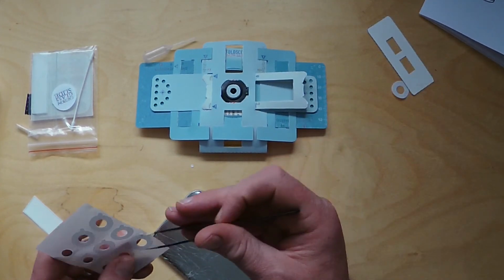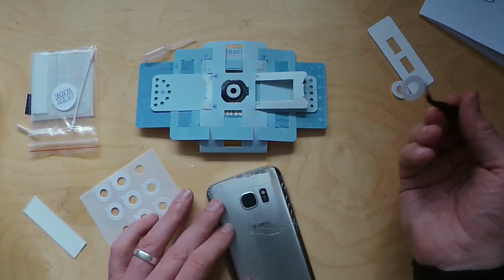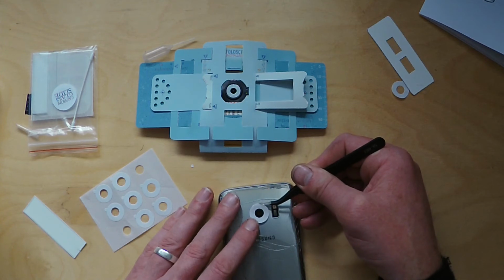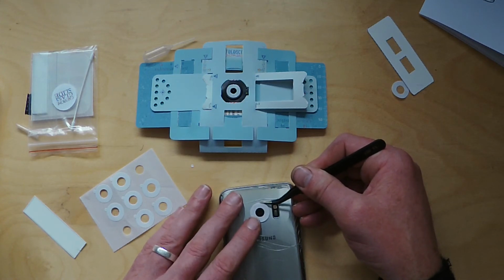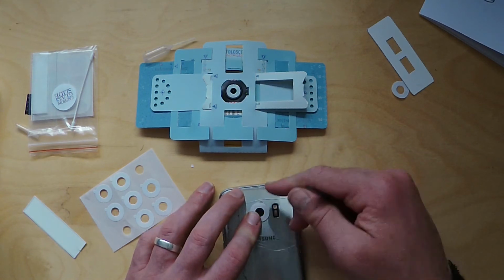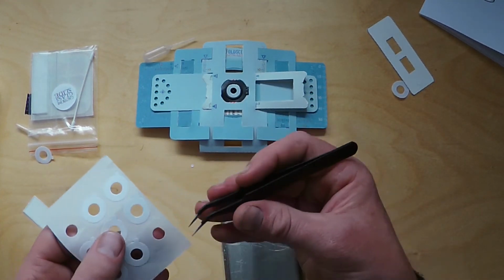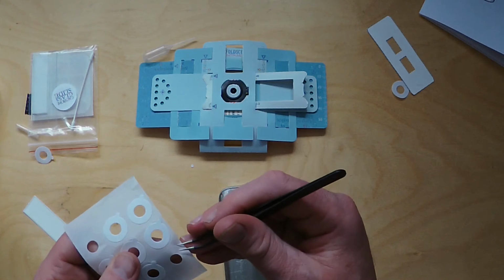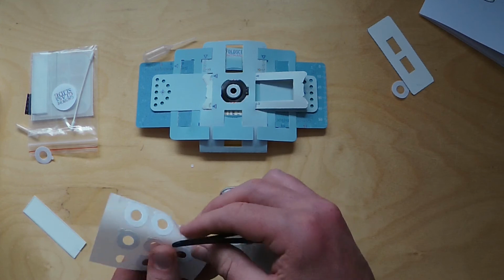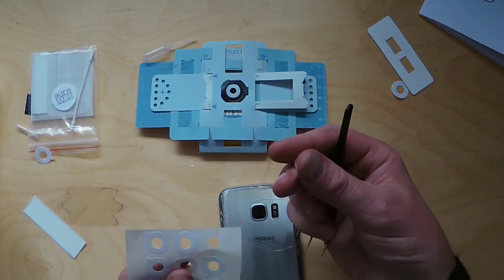Tweezers does help. What you want to do is take the sticker and place it as centrally as you can over the lens of your phone. So if you have a phone that's quite fancy and it's got more than one lens, oh, I've actually not brought the sticker with me there, which has never happened before. Okay, there we go.